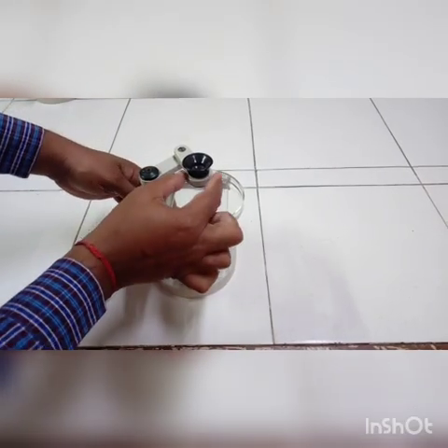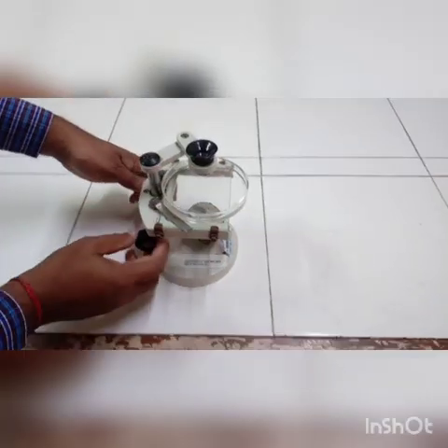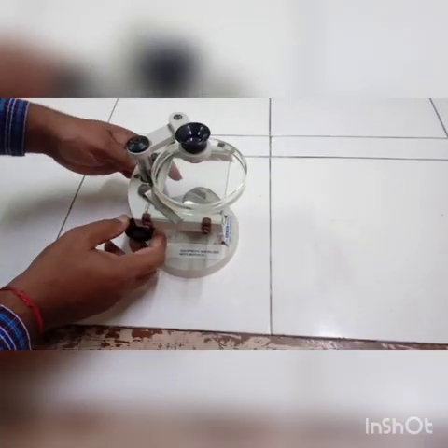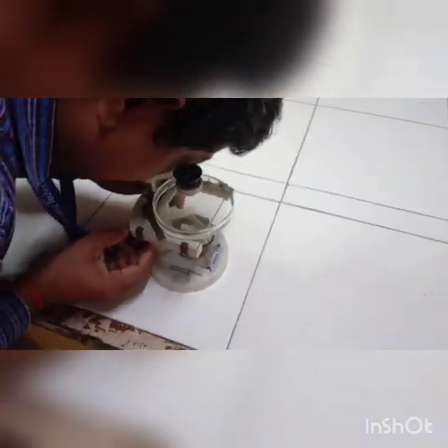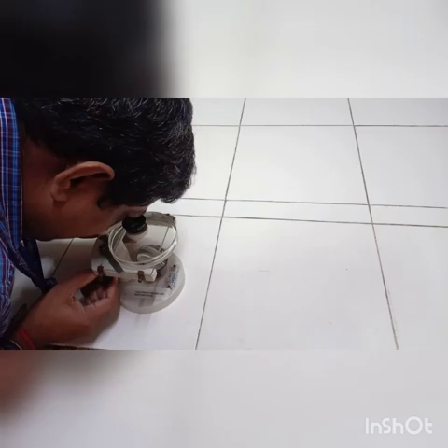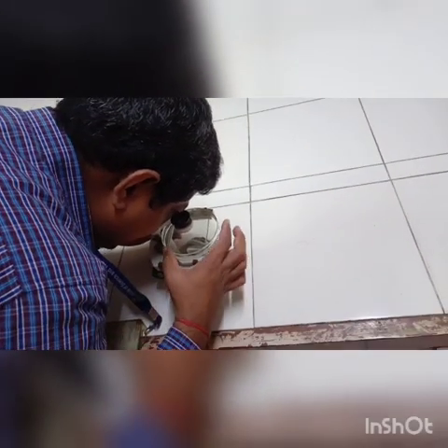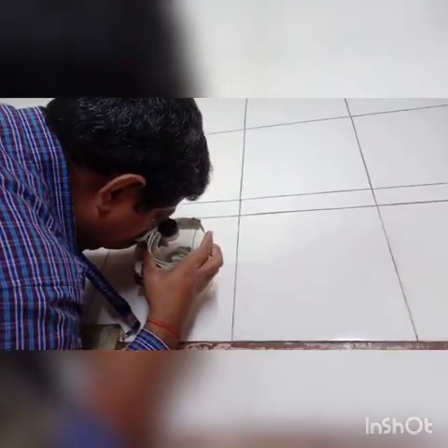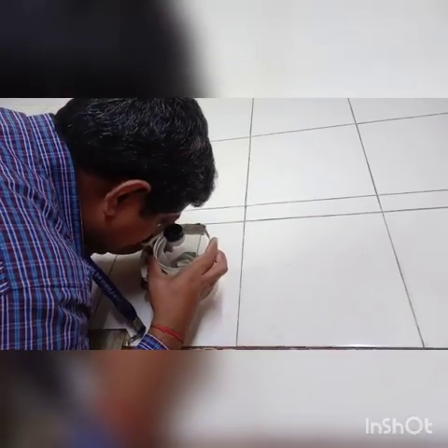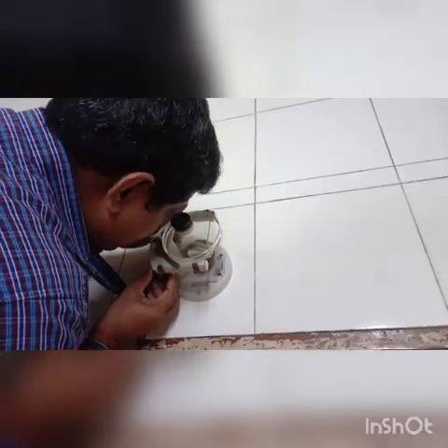And we have only one lens, that is the 10x lens, and with the help of this 10x lens you have to keep your eye on it, and then adjust it in such a way that you can clearly see the image of the specimen that is present in this petri plate. So now I am adjusting the image in such a way that I can show you through this lens how the embryo is going to look.